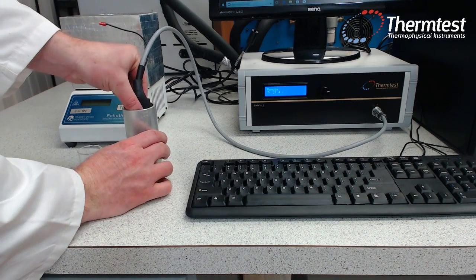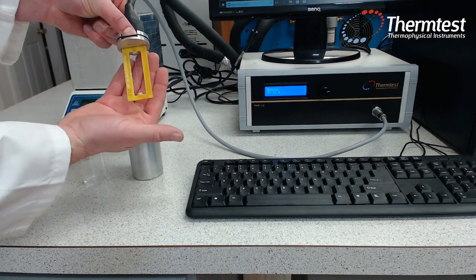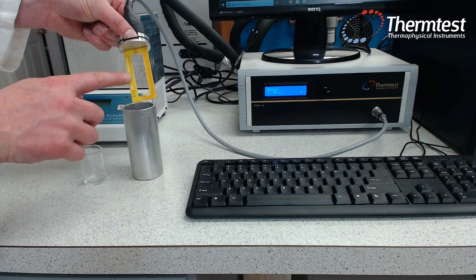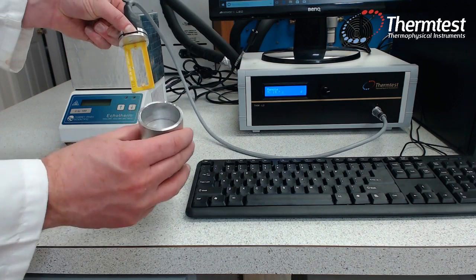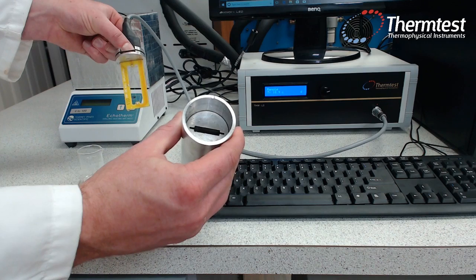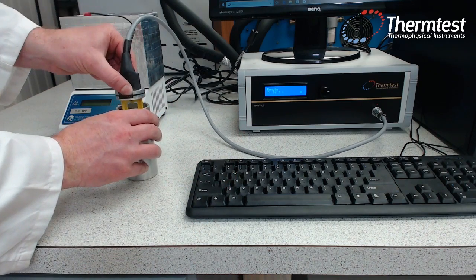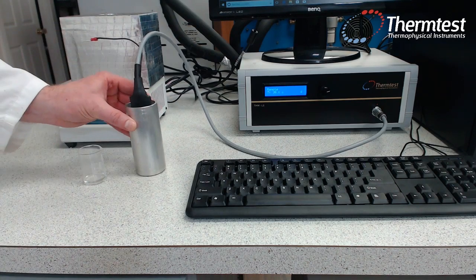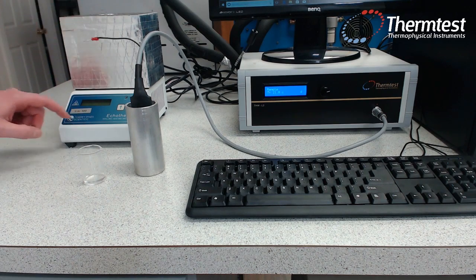So we can pull the sensor out, and as you can see, it's a wire suspended between our THW cell. There's also a temperature sensor here on the side of the sensor. Our cell that comes with the system holds, in that small volume area, about 15 milliliters of fluid. So this is a really nice way of controlling size as well as convection. Again, this can be inserted into our thermoelectric dry bath, for a range of 0 to 100 degrees.